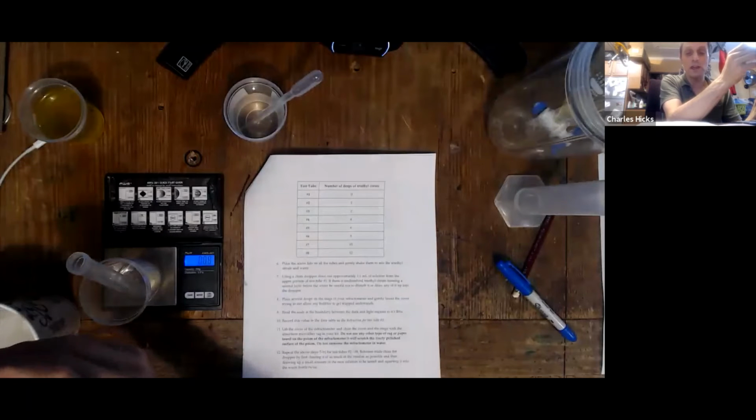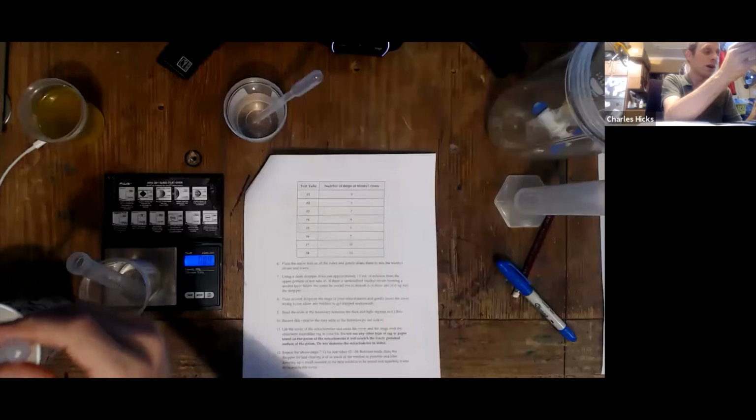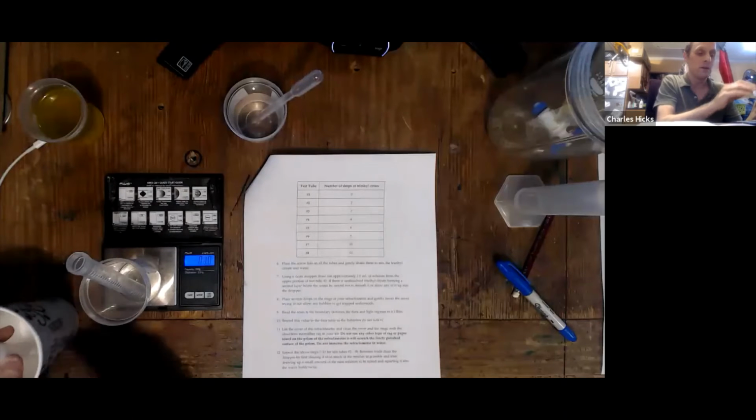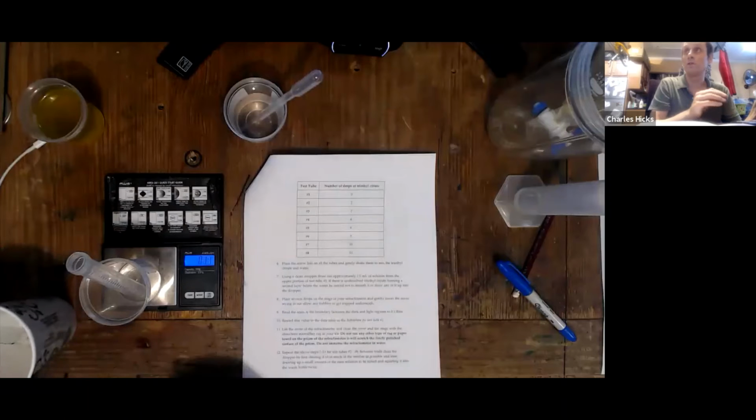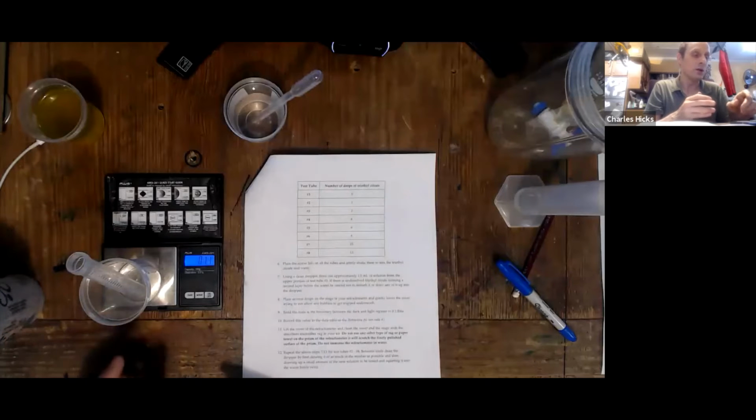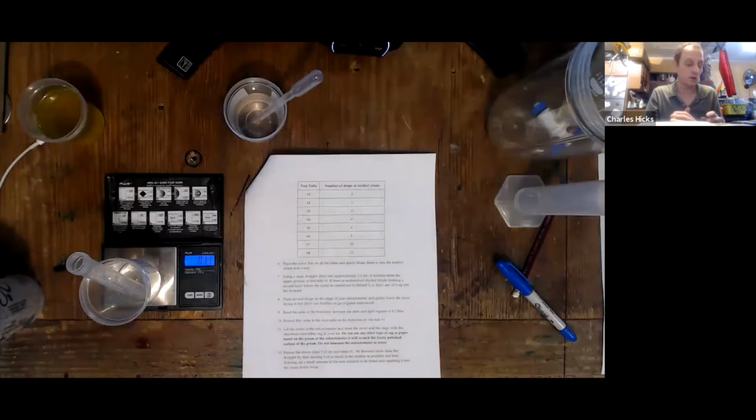So I've zeroed the scale, and it says to put 1 drop in for trial number 2. So I put in 1 drop. 1 drop may or may not register on your scale, but whether it does or not, we know that 1 drop is added, and we can figure out its mass from our earlier work. Then the other part is to add the solvent. In this case, we're going to do the water-based example one, but you'll also do a set with canola oil.